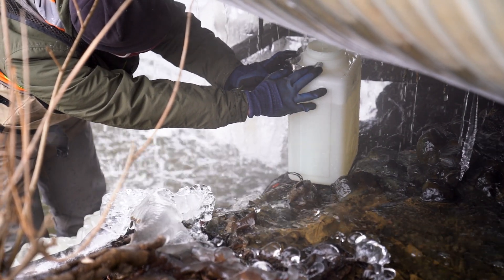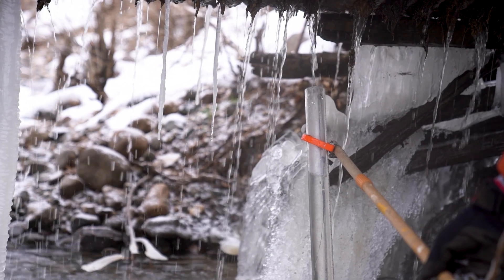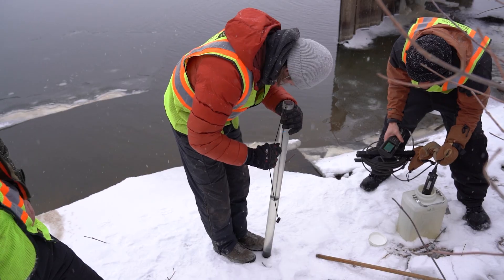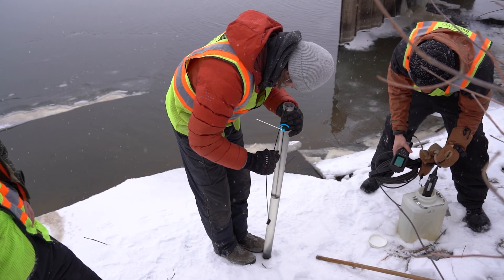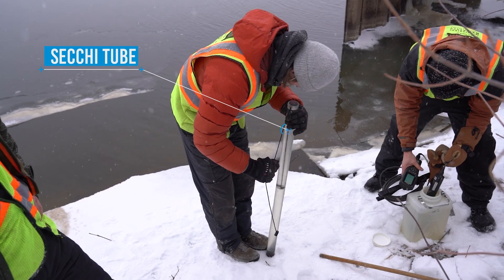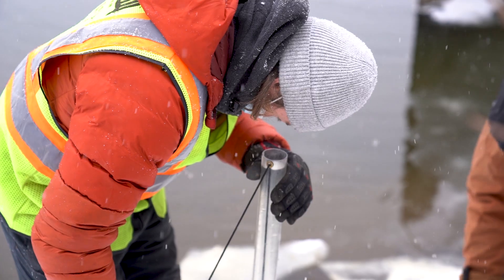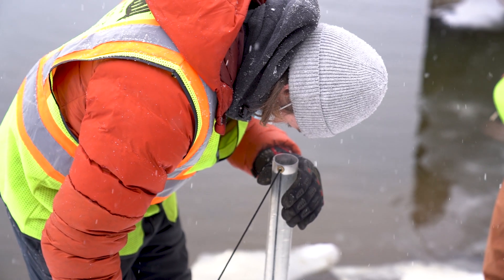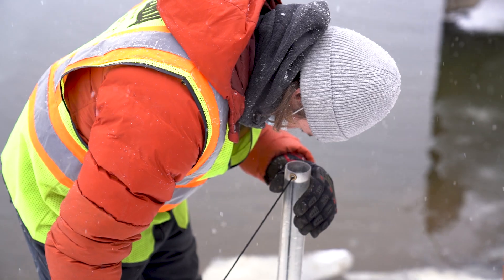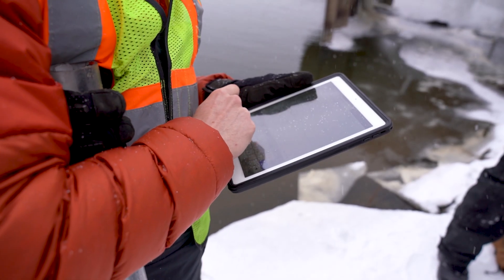We also fill up a Secchi tube. The Secchi tube is used to measure the transparency of the water. You look down the tube, you see the disc, and then you measure the transparency of the tube. Today it was about 41 centimeters.